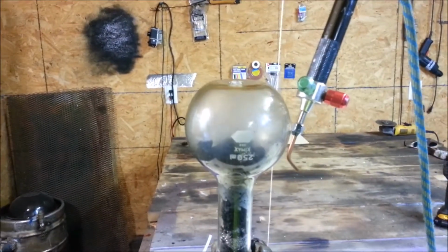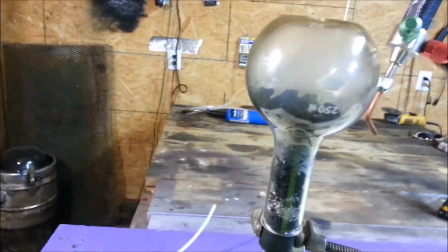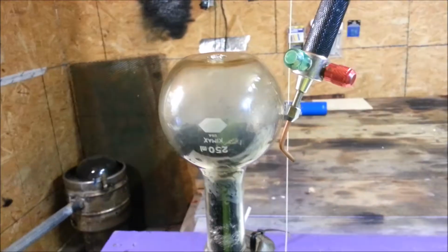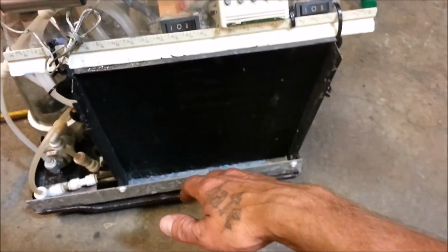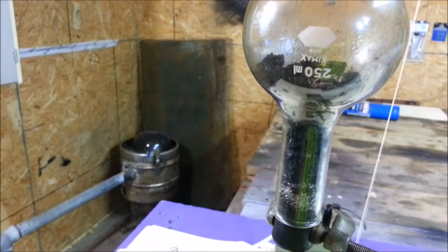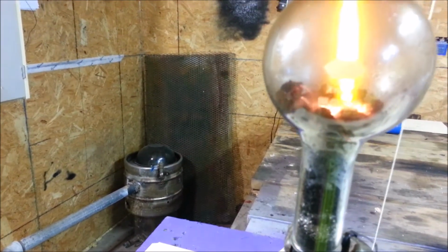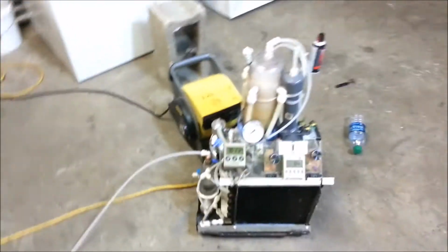So we are going nowhere with that experiment. It doesn't work. And that's a lot of pressure. I am at like 1800 watts. This thing's cranking some heat. Nothing. You gotta shut it off.